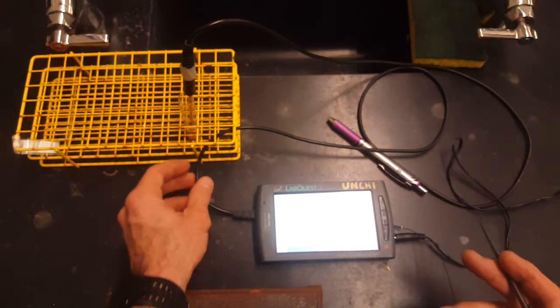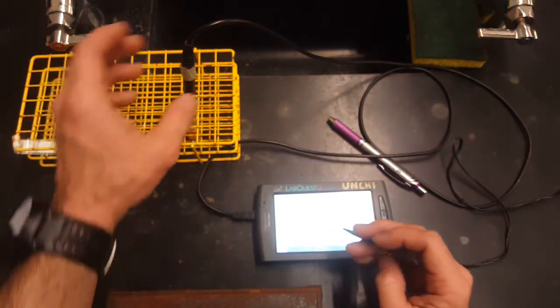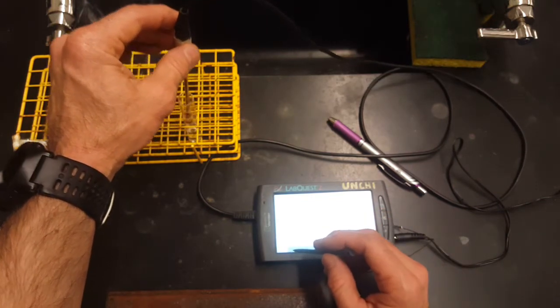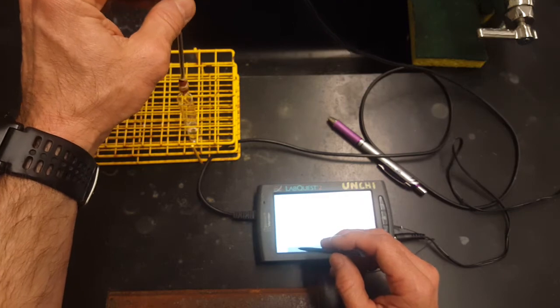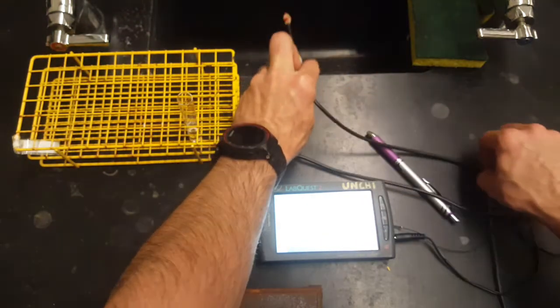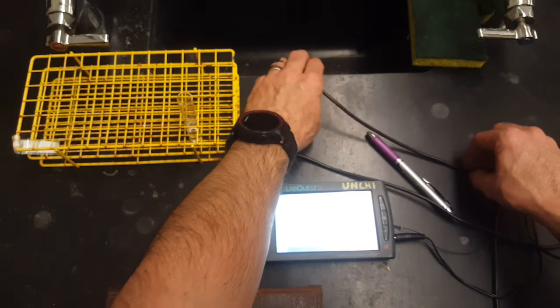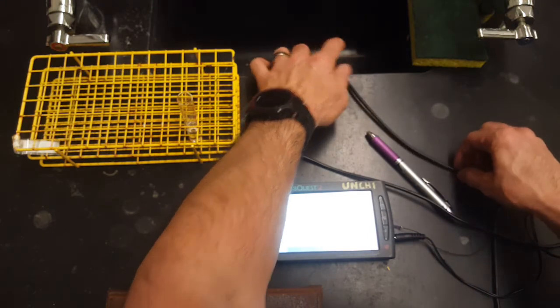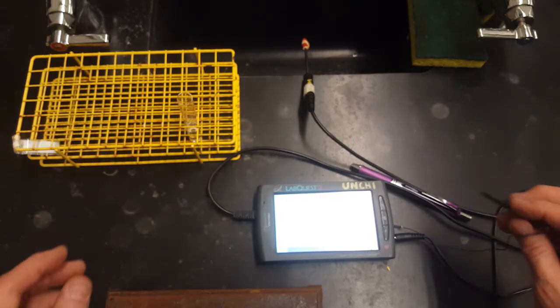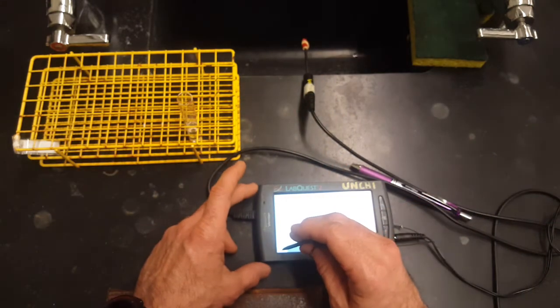So I'm going to click play after I pull the thermoprobe out. So the thermoprobe's out, let it drip off a little bit, and then I'm going to drape the thermometer into the sink. I don't want it to touch anything. I want it to be protected from the wind. I really like that. And then I hit play.